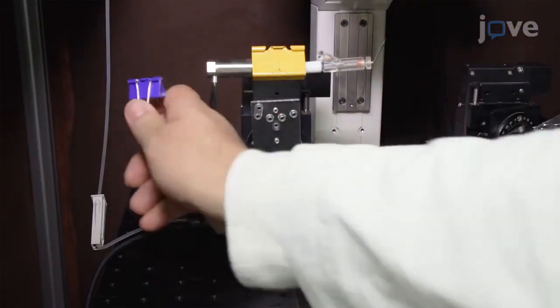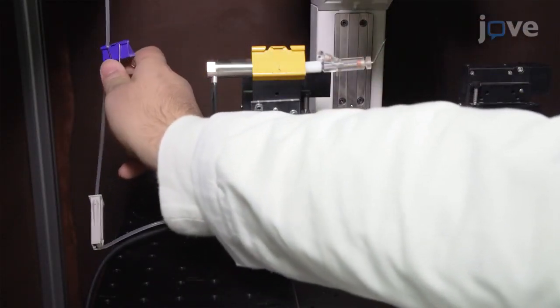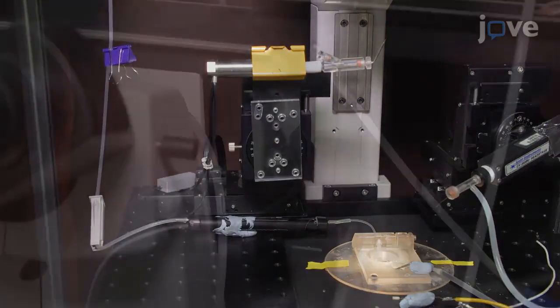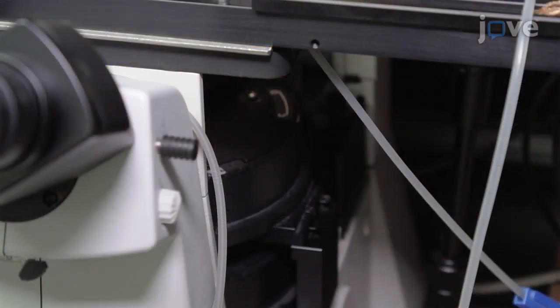To stop the fluid flow, clip the tube at the container side to block the fluid flow. Then, clip the tube at the suction side to stop the suction at the same time. This is the stationary control condition.